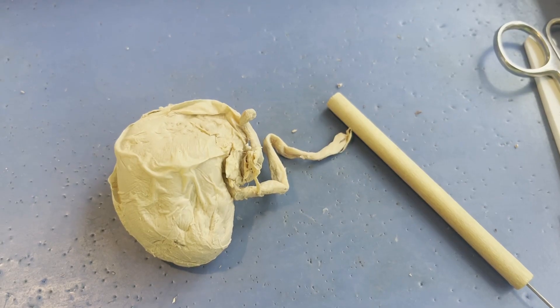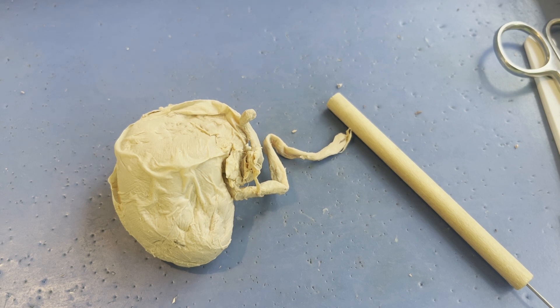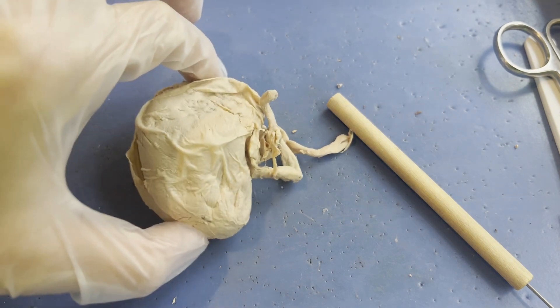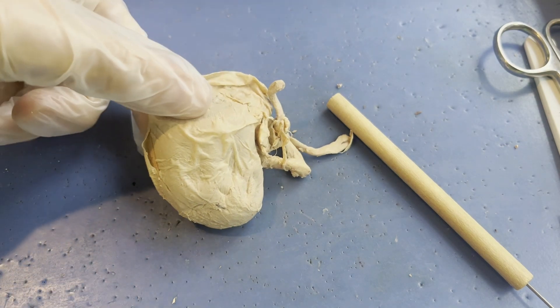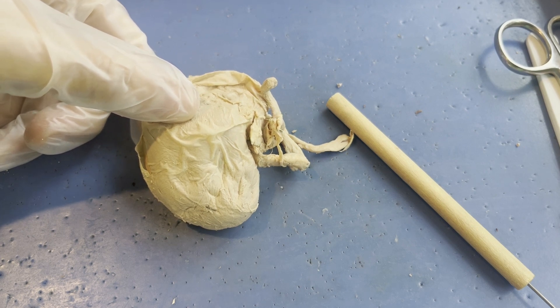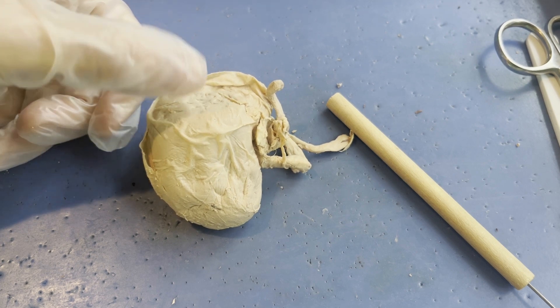In order to further our understanding of the anatomy and physiology of a human kidney, a sheep kidney or a cow kidney dissection are a great way to dive deeper into this filtering organ of your body. In this specific dissection, I am looking at a sheep kidney, which is usually much smaller than a human kidney. If you take your hands and make a fist, that's the size of your kidney typically.